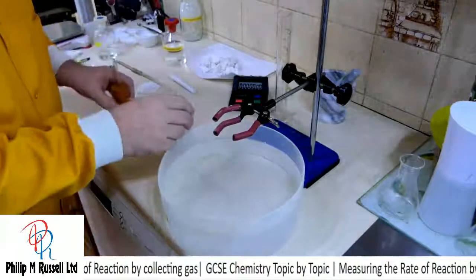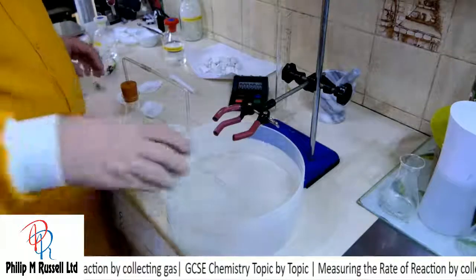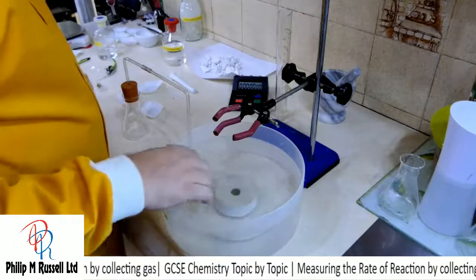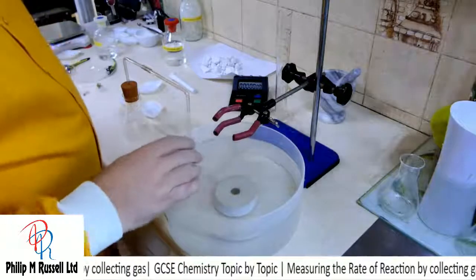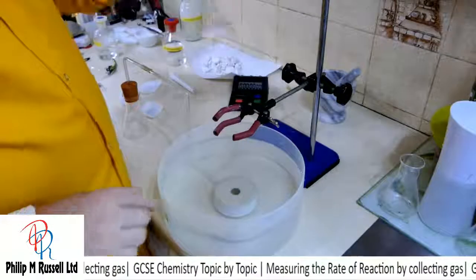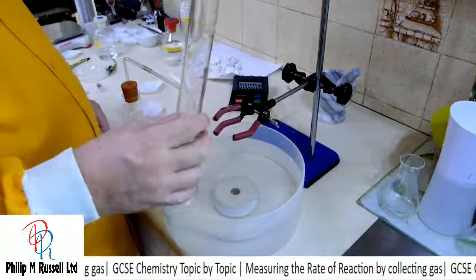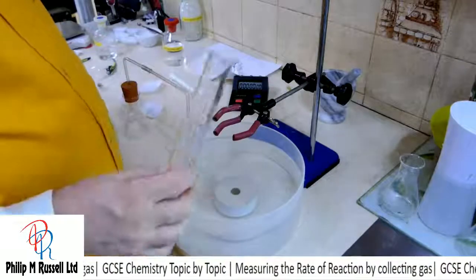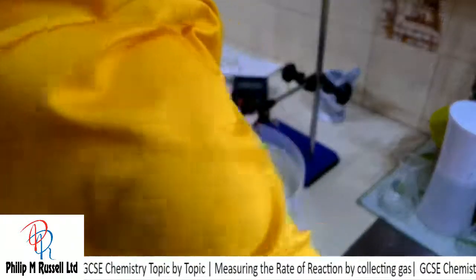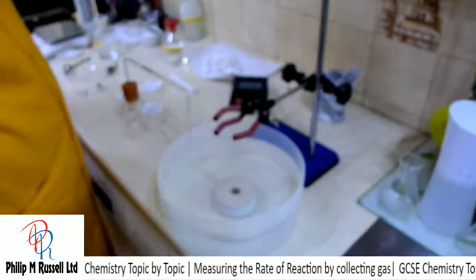We've got the tubing set up. I'm going to put this beehive shelf in the place. I should have rinsed that before. It's a little bit dirty. And now I've got a problem. What I've got to do is fill this up with water, tip it upside down and put it in. And Paul's just going to wash that out and give it to me, and I'm going to show you the easy way that we can actually set this up.